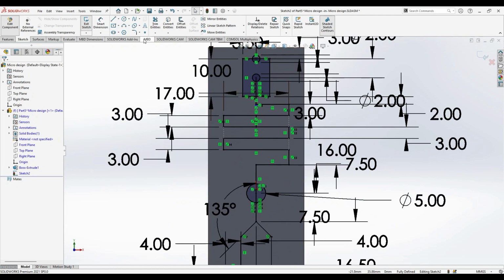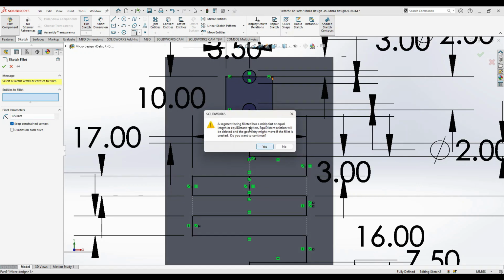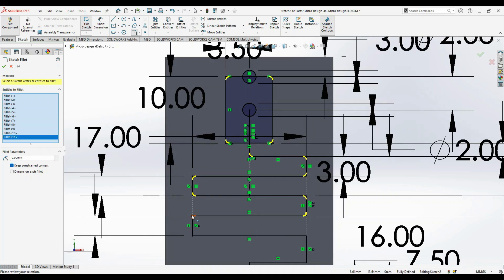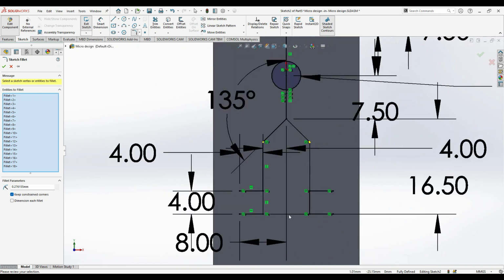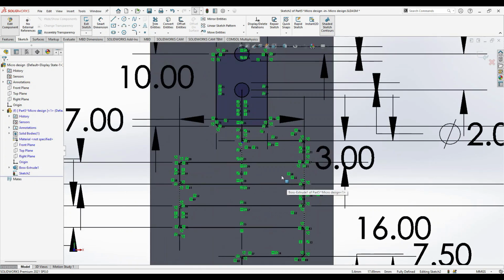And what we do is just we do a little fillet things. So these are all the sharp ends. Change the radius to, let's say, 2 mm. So 2 mm is too much. Let's try 0.5 mm. Yes, so 0.5 mm is fine. So just create the fillets, 0.5 mm. Okay, just press OK. Now all the fillets are created.